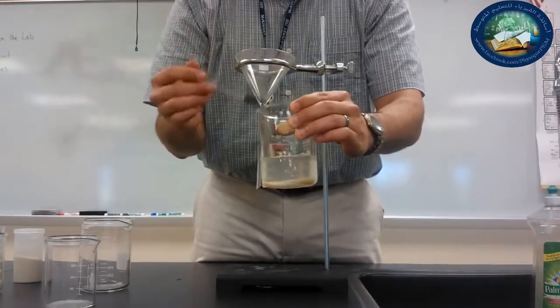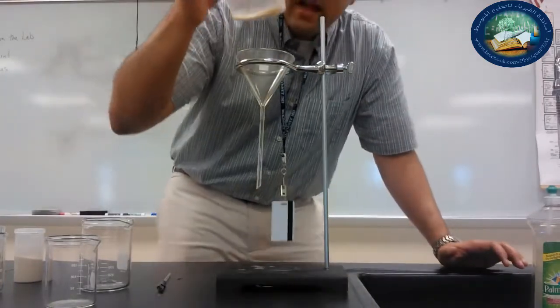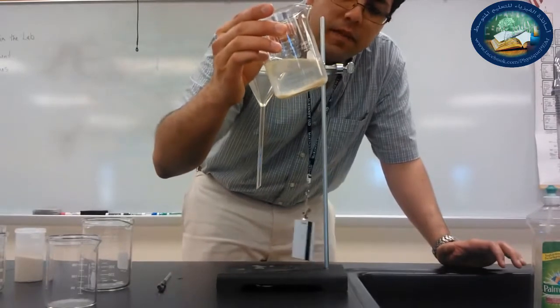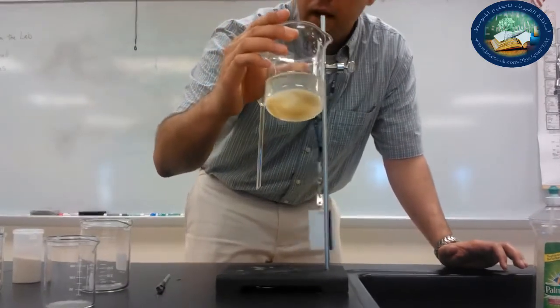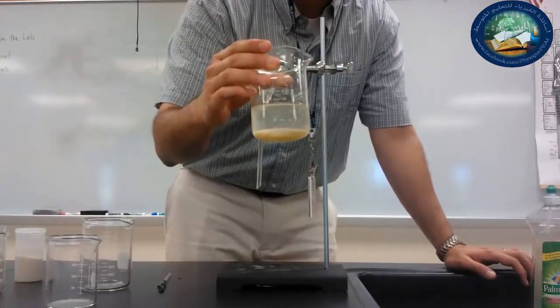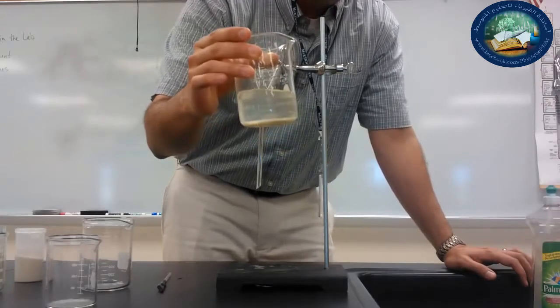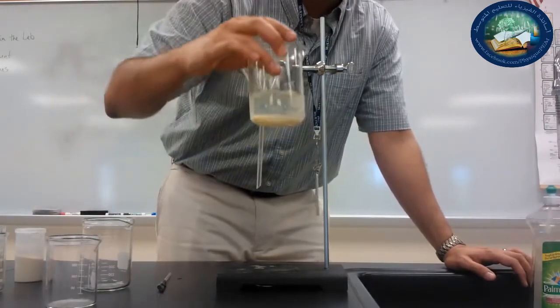So I've stirred it long enough. We're satisfied. This is a mixture. And we can see that I've got sand and I've got water in here, and I would like to be able to separate them as much as possible. So the first technique that we can use to separate a solid that does not dissolve in water is we first allow it to settle down.